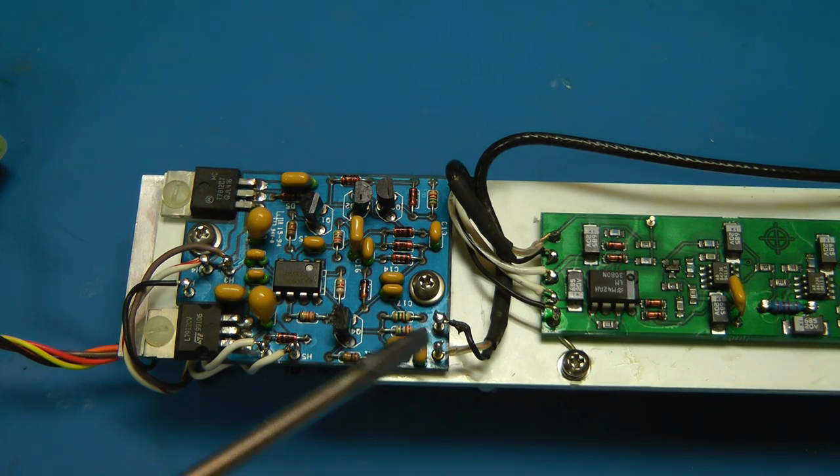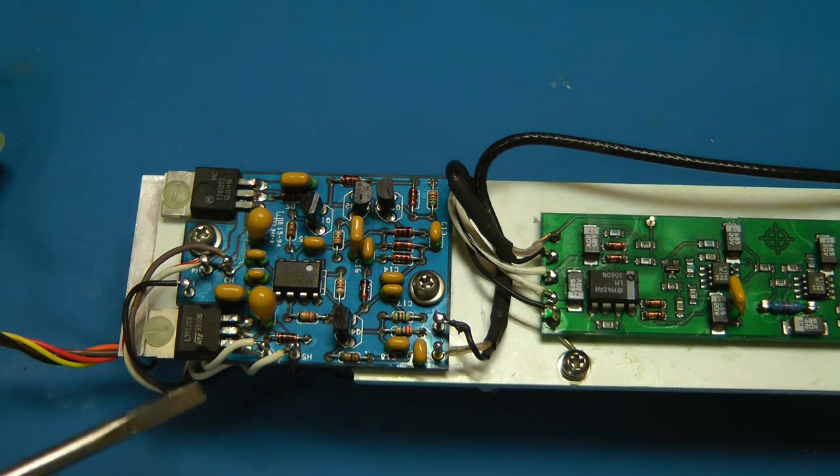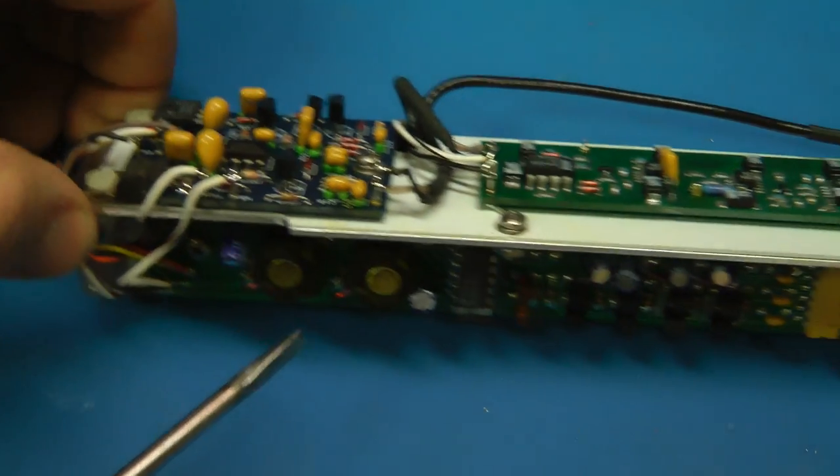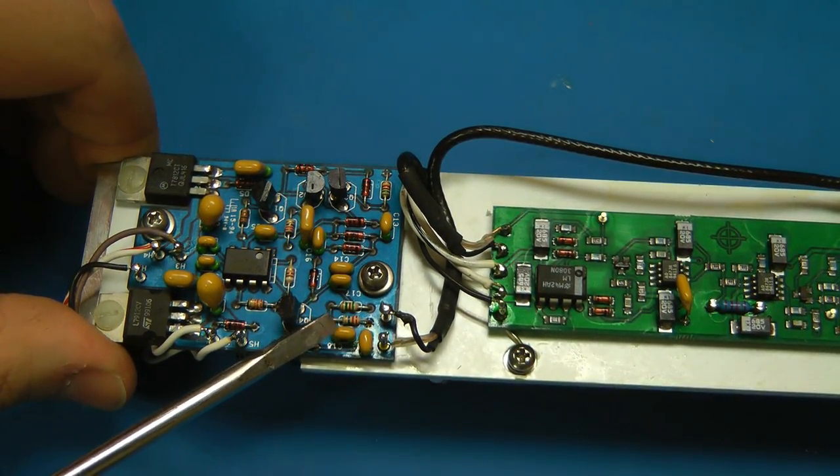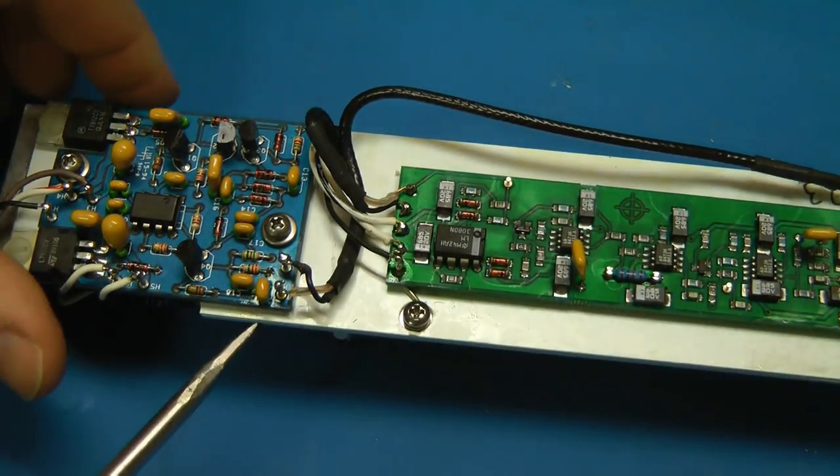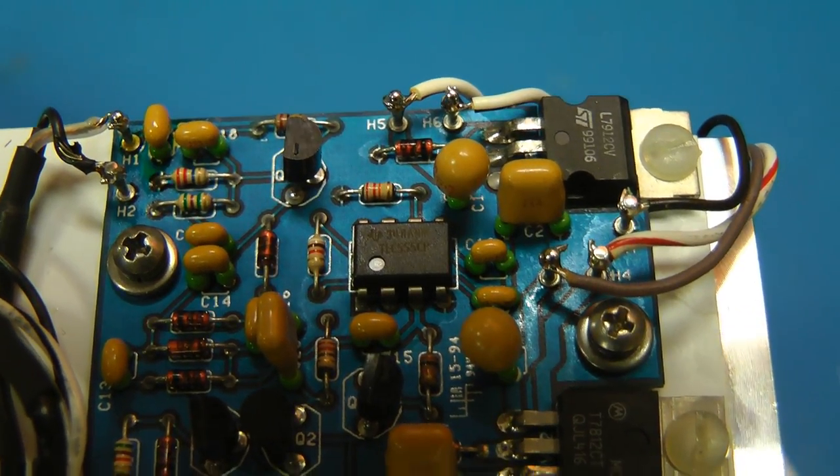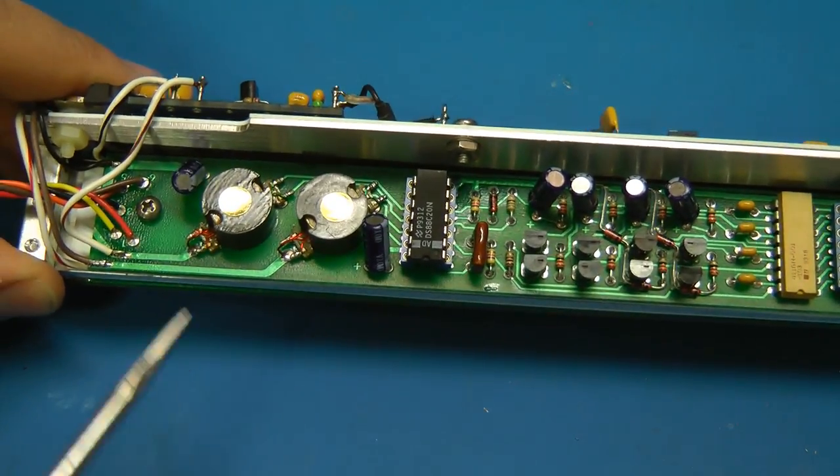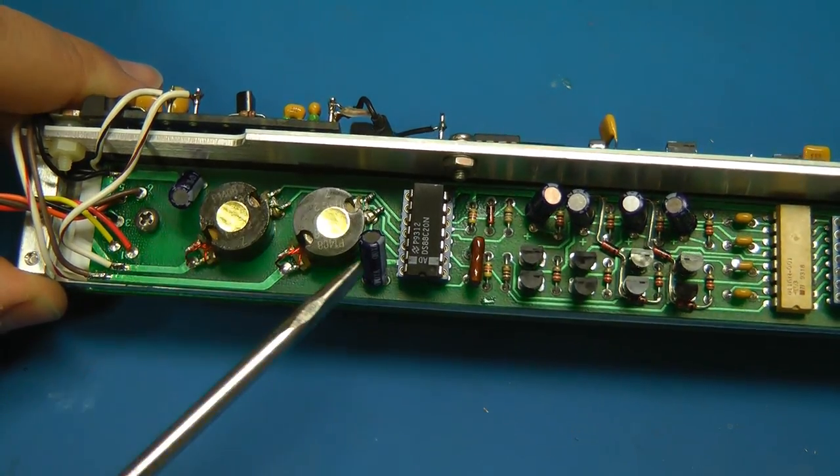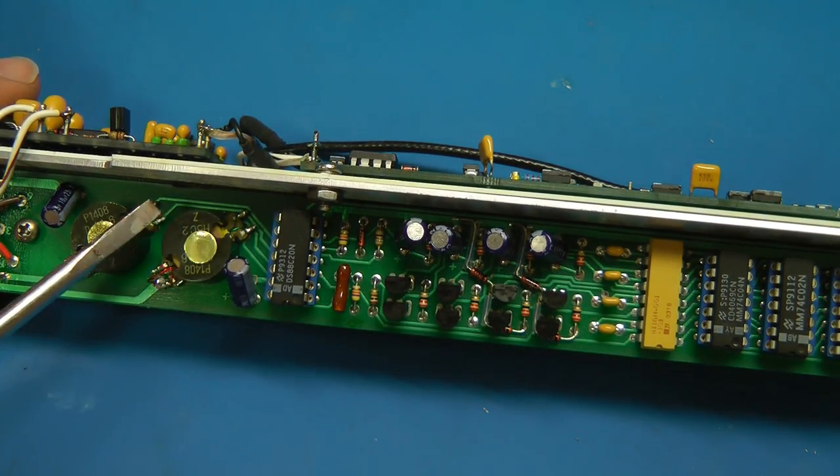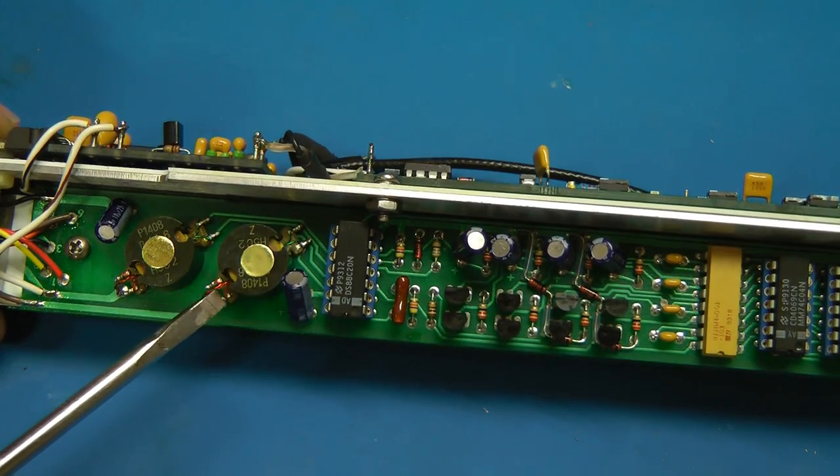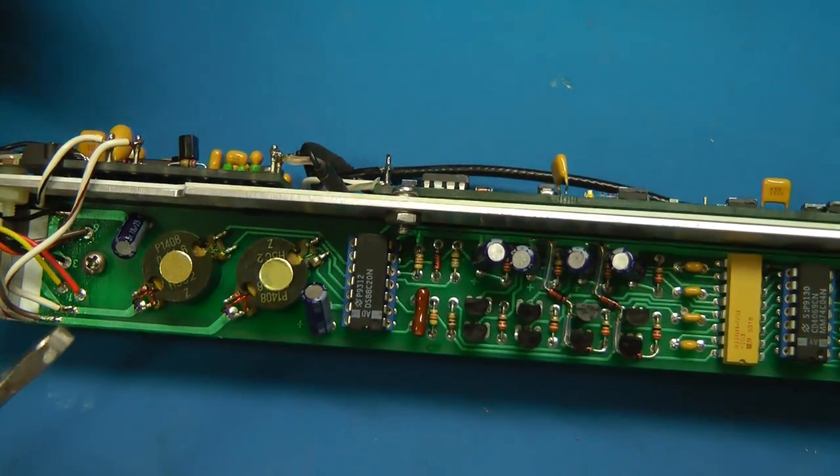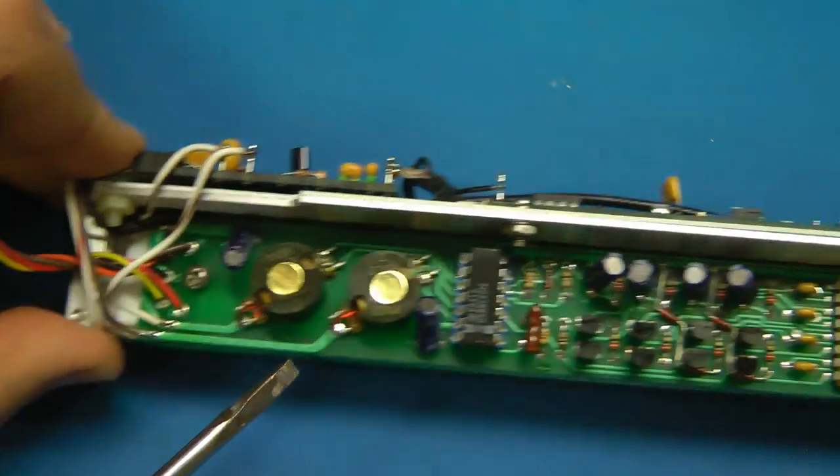Beyond this there's a couple of 847 50 megahertz op-amps. And there's some other LM 3080 probably comparator or op-amp. And that would generate, I believe, an analogue pulse output that would go off to one of the other boards. This other board in the end looks to be a power supply of some sort. There's a plus and minus 12 volt regulator. Some connections down to another board on the side. It also seems to be power supply. But yeah this seems to probably would generate a very stable voltage or adjustable reference voltage for the photodiode. And that chip in the center is a good old 555 timer.